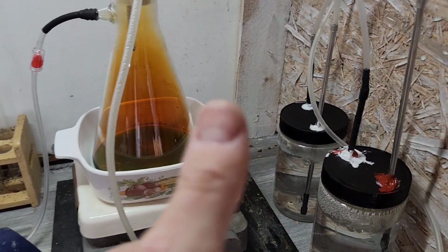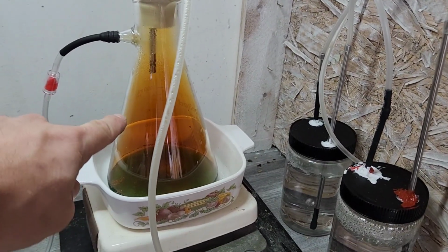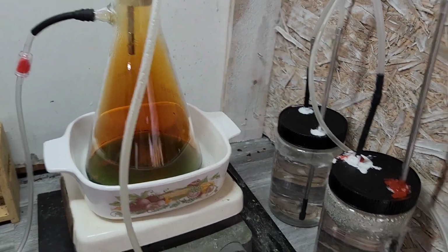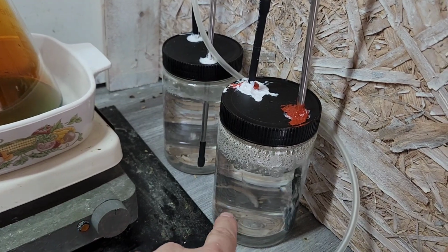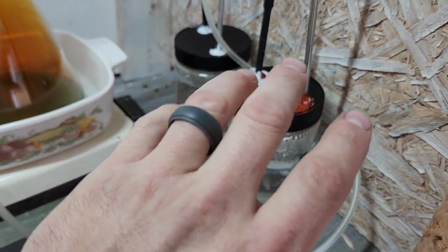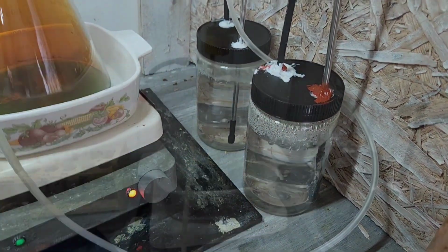One, it's going to be safer for everybody in the house. It's going to be safer for the environment because we're not just dumping these fumes outside, right? And we get to make a little bit of nitric acid. Not too shabby. Oh, I don't mind those caulk jobs. Those things are, yeah, just mint.